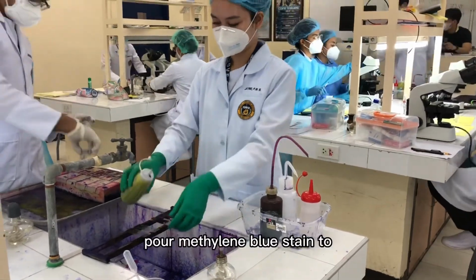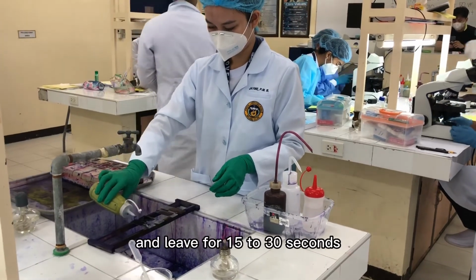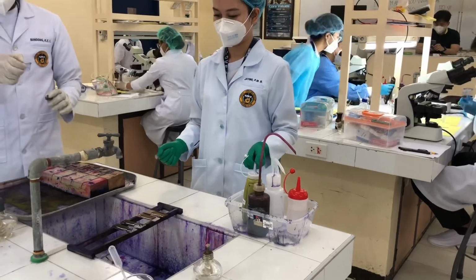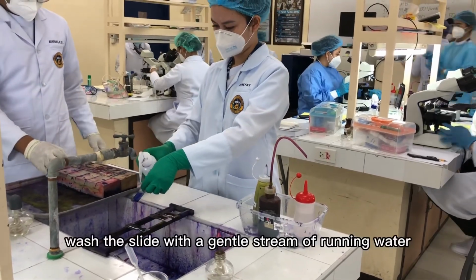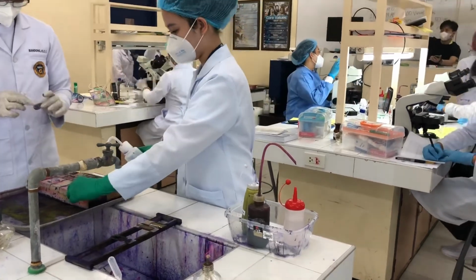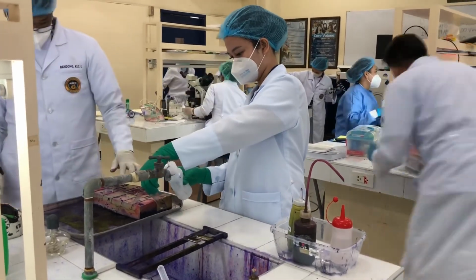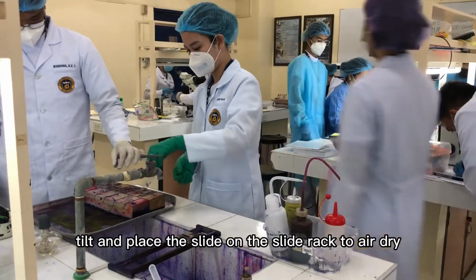Counterstaining. Pour methylene blue stain to cover the whole surface of the slide and leave for 15 to 30 seconds. Pour off the methylene blue stain. Wash the slide with a gentle stream of running water. Drying the stained slide: tilt and place the slide on the slide rack to air dry.